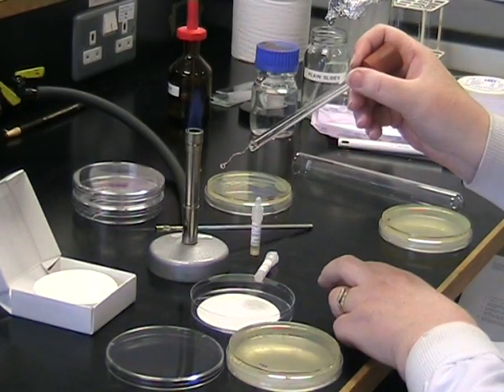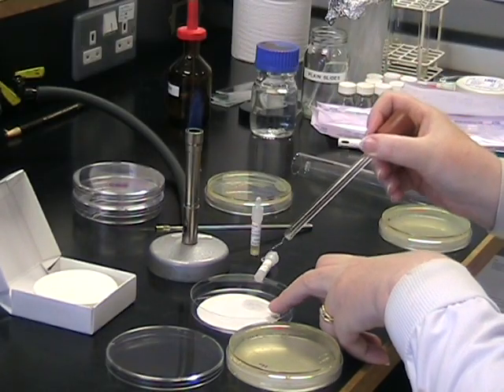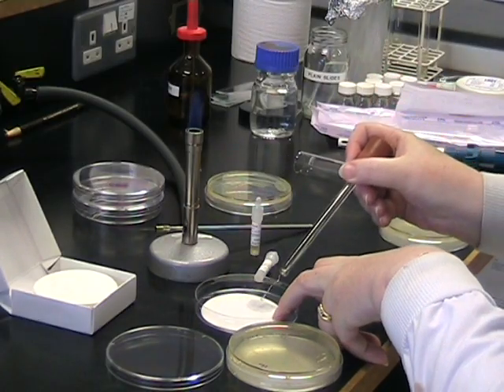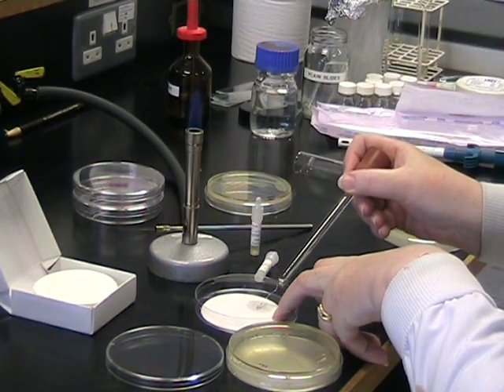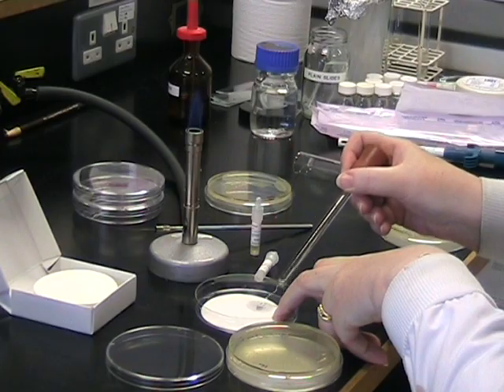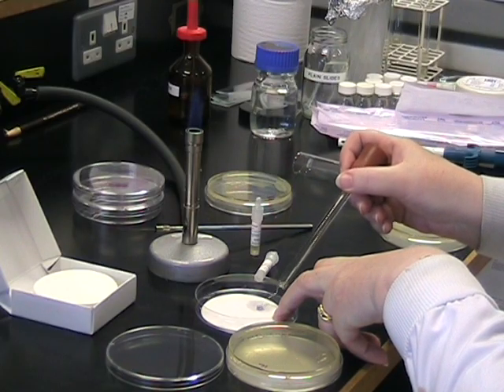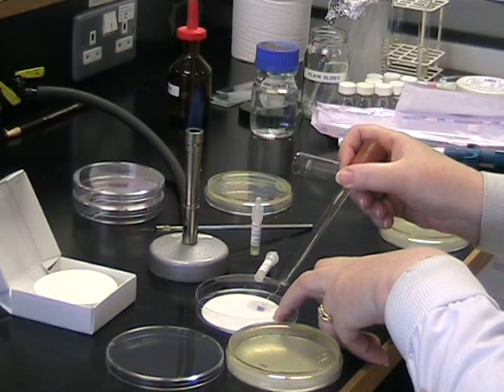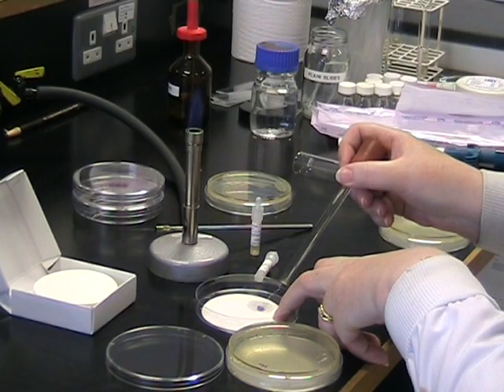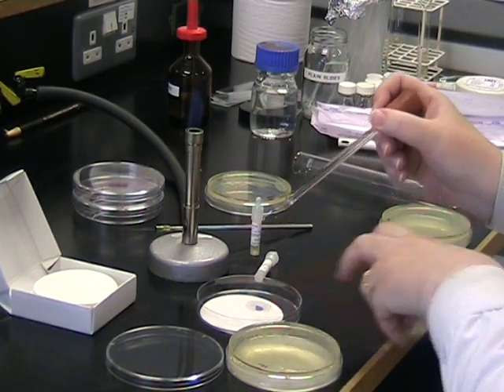Rub this sample onto the oxidase reagent on the filter paper. A positive result is indicated by the almost immediate formation of a blue colour. Flame your loop when you have finished.